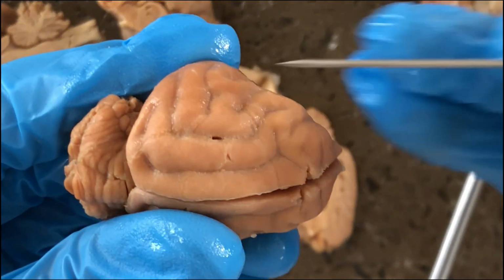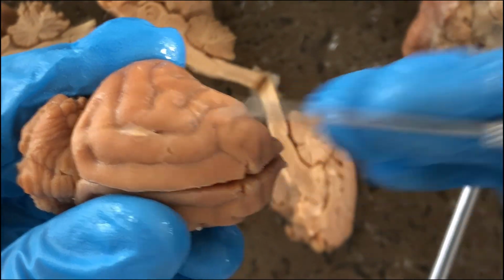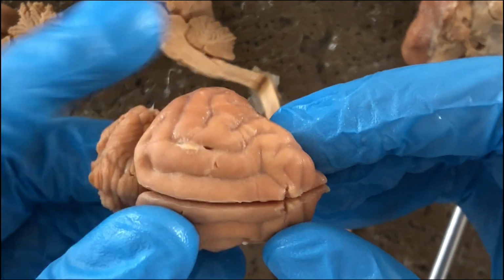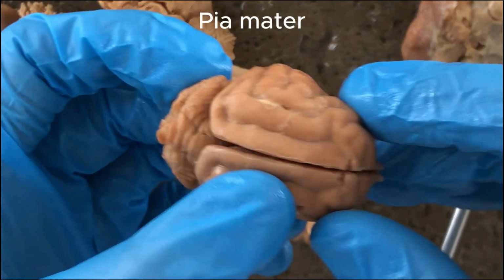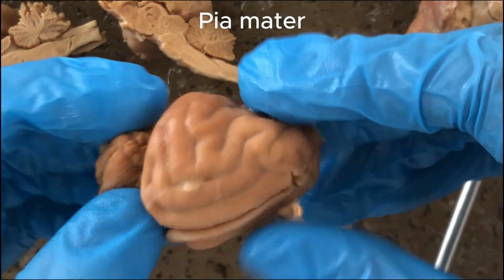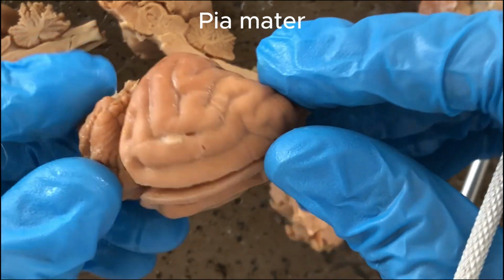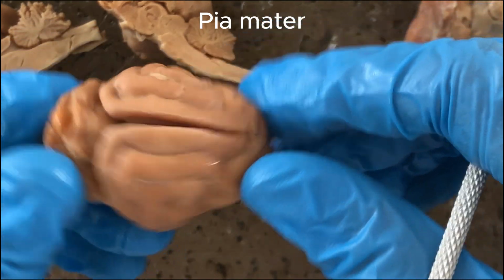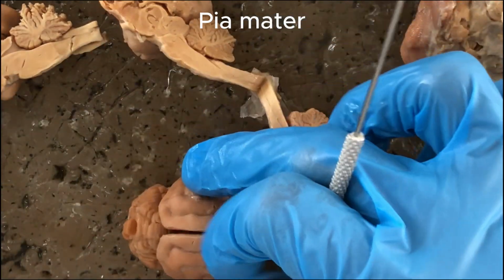The second would be the arachnoid mater, and the 3rd and deepest meningeal layer is the pia mater, containing lots of blood vessels. It's highly vascularized, so one of its functions would be to supply blood nutrition to the brain, which is a highly active organ.